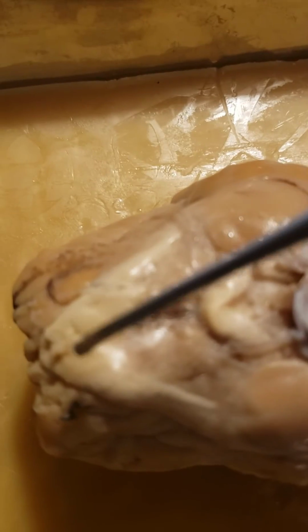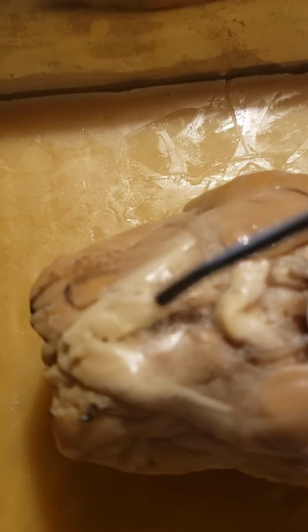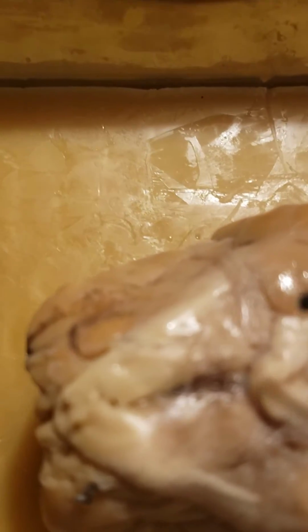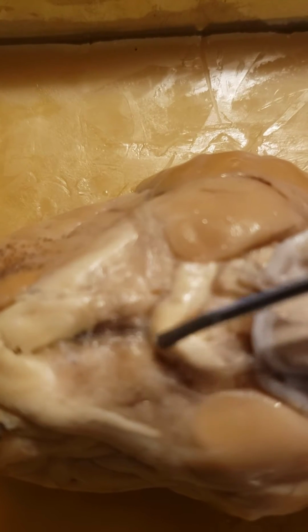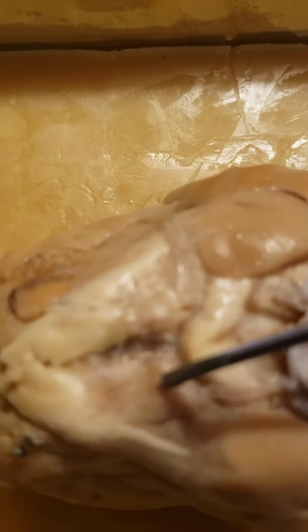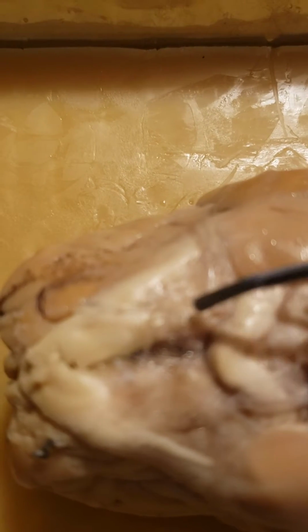And then this next on the list. The olfactory bulbs are here on each side. And then the olfactory tract is over here. The optic nerve is actually cut on this, so it would come off of here, or the optic nerve is cut on here.